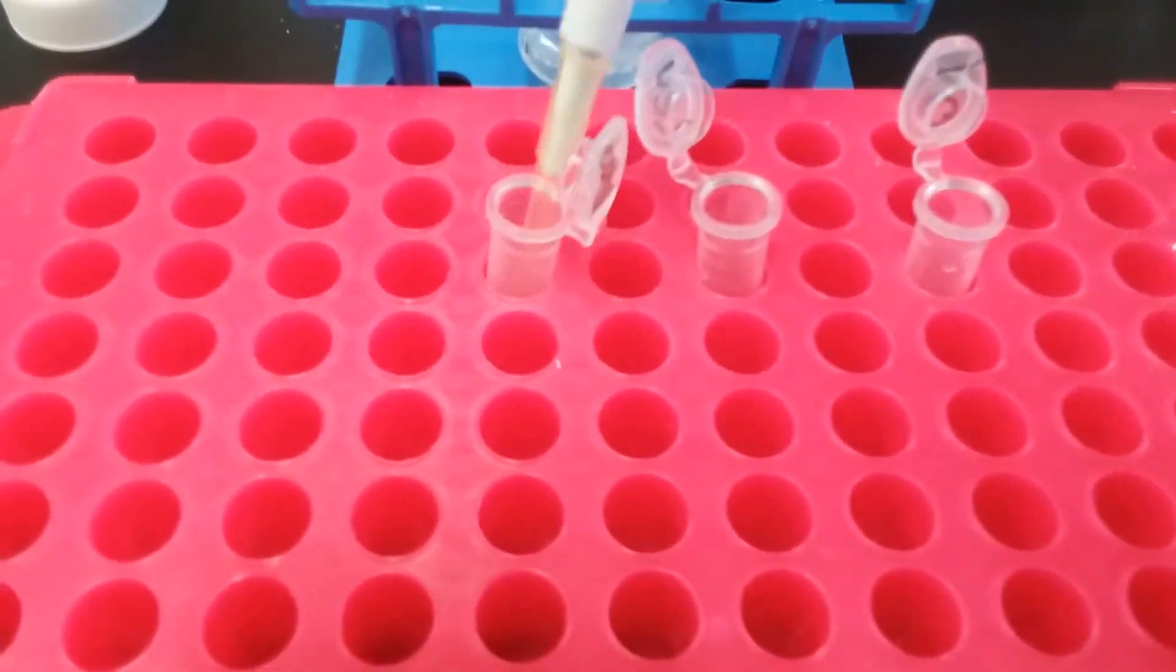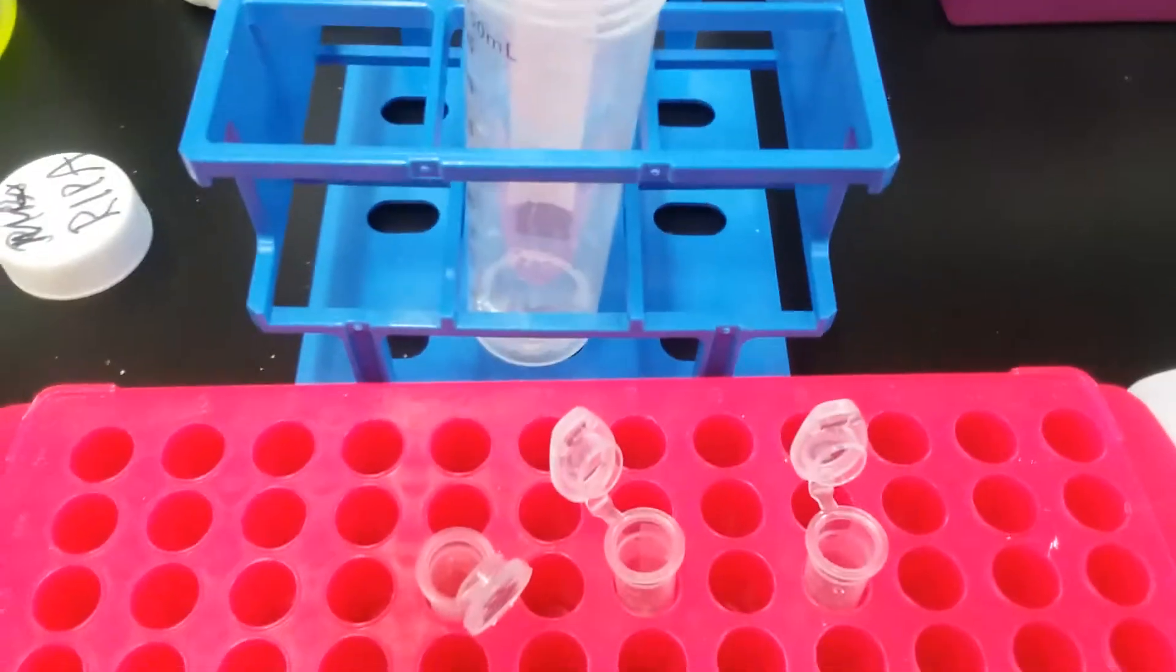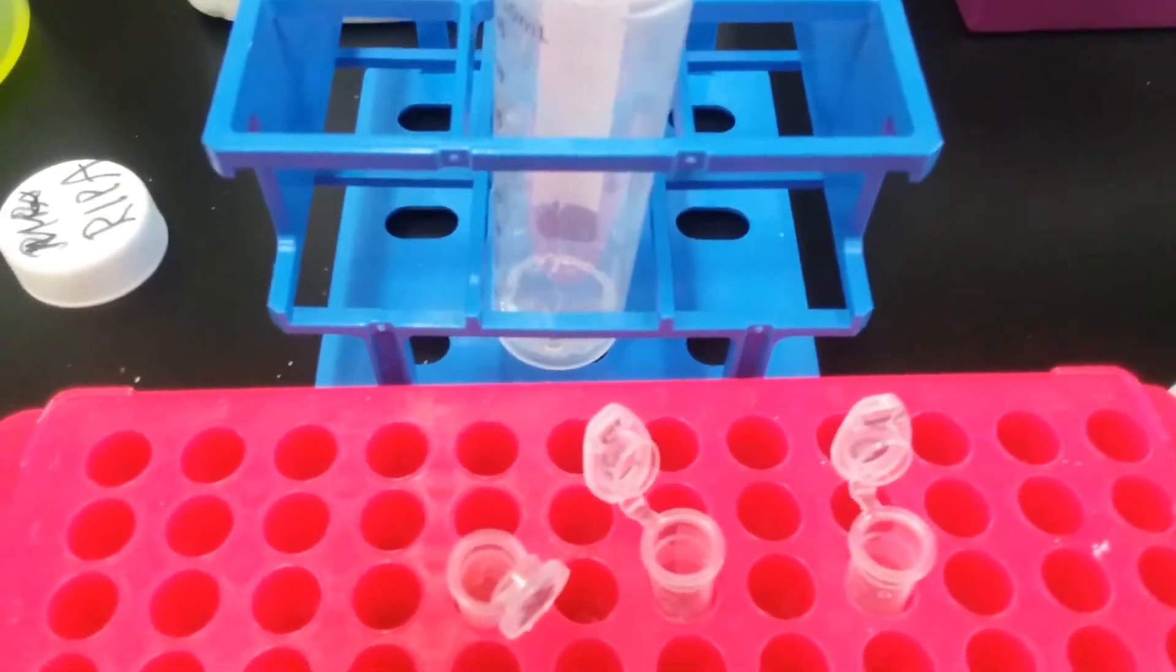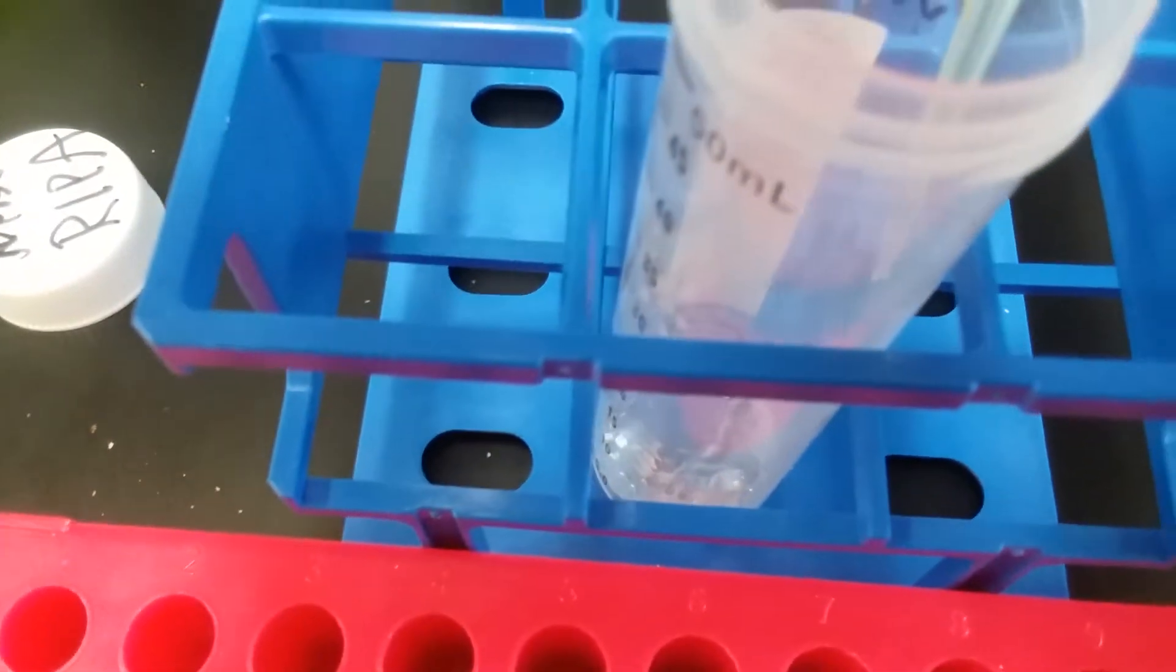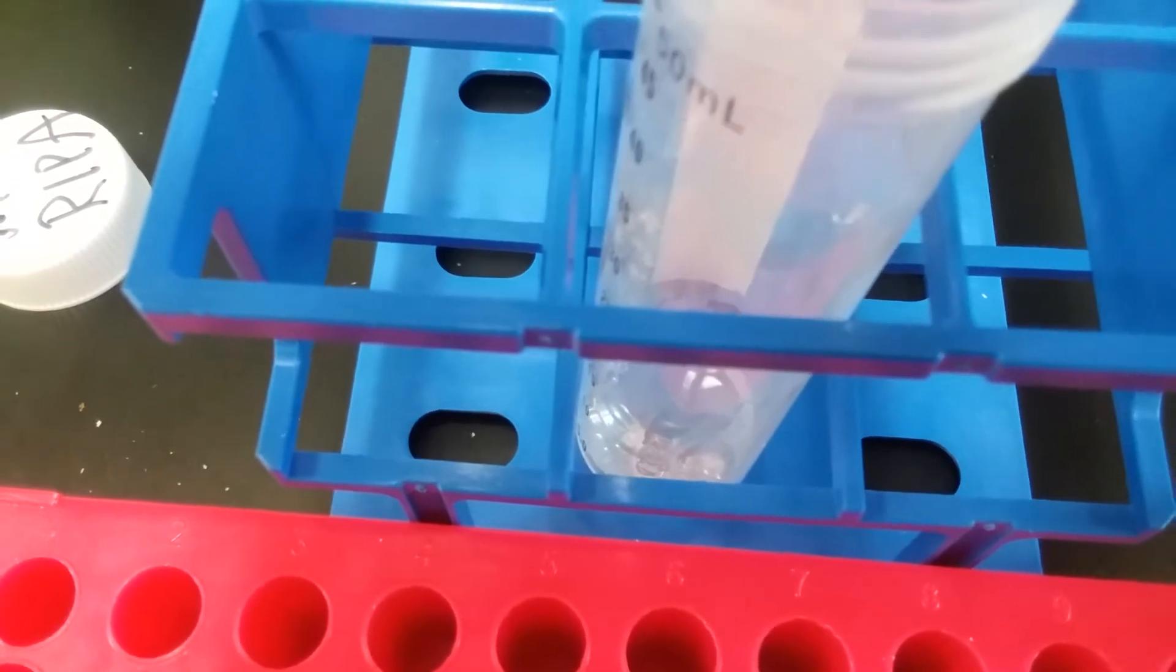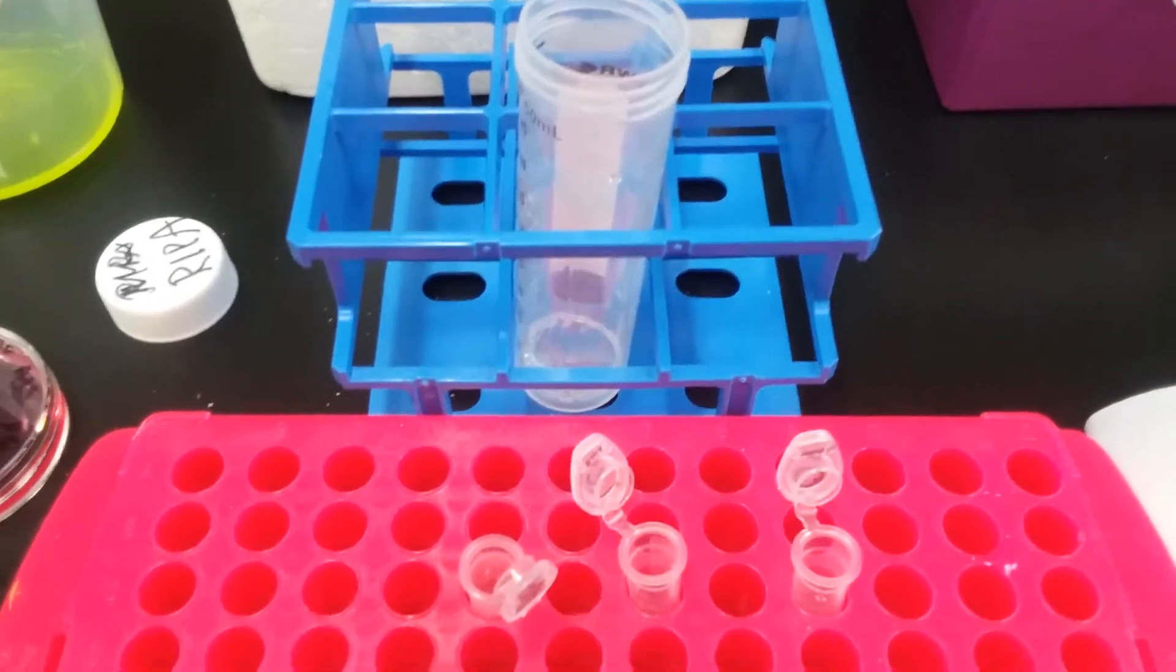And I do want to point out that these are very low volumes, so when you're looking at 3 microliters, it is going to be super low, and so when you go to put it in your tube, just kind of drizzle it on the edge, and you see that little drop of liquid, make sure it goes into the container at the bottom, the liquid at the bottom.